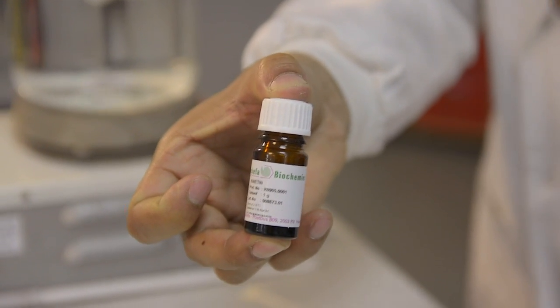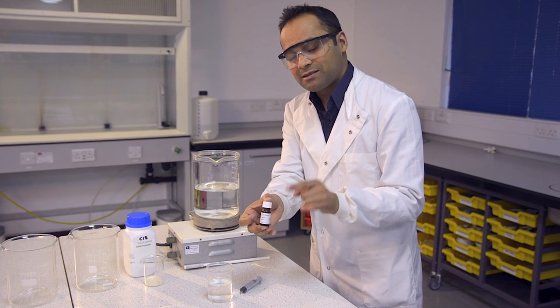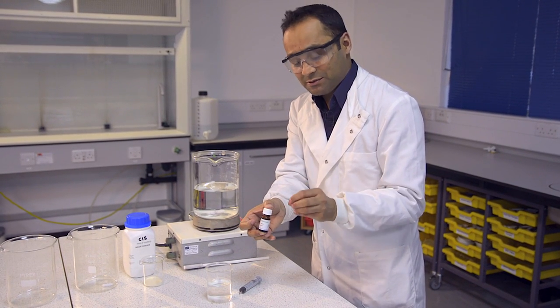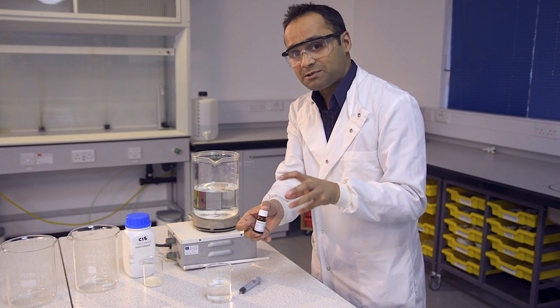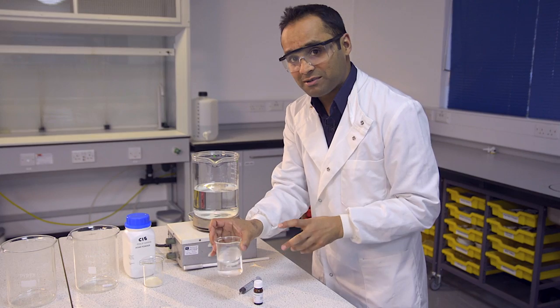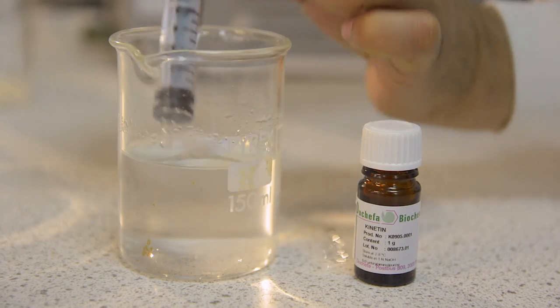This is kinetin, which is a substance that will make the cells divide, and it's really important that you get the quantities of this quite precise. You need very small amounts of it, which is difficult to measure out precisely, so SAPS recommend that you use 0.1 gram of it dissolved in 100 millilitres of 70% ethanol, and then you use 2.5 millilitres of that.